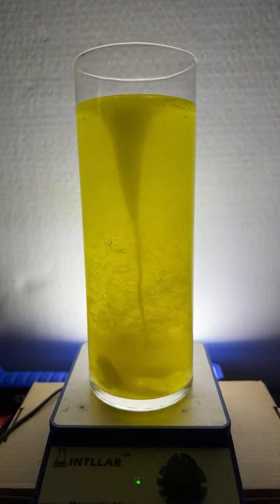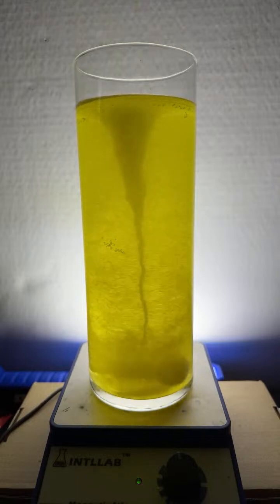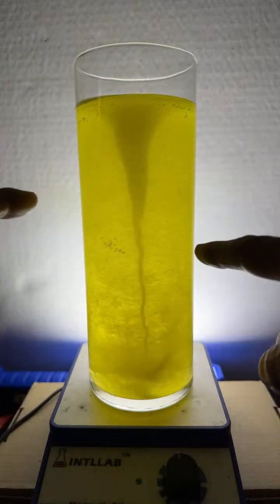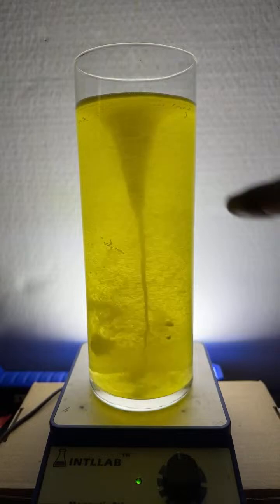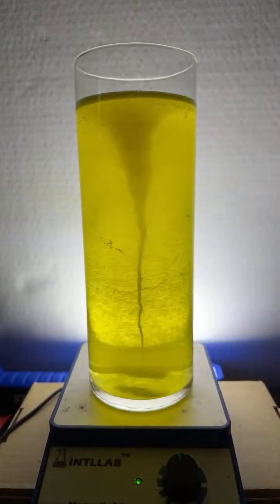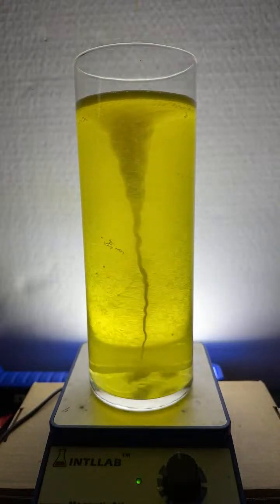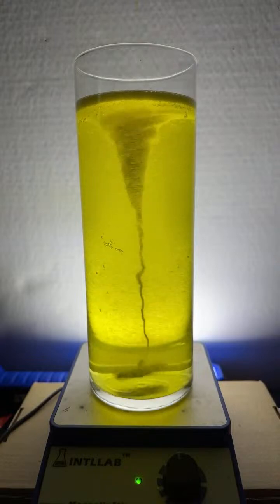And Lila, what I want you to notice is, where do those bubbles end up? I mean, I see them out here on the side, but boy, they sure do seem to be concentrated in the middle, don't they? They're concentrated in the vortex and in this middle here, which is kind of interesting. And you can see it even better once everything kind of calms down. I can hear the bubbles.